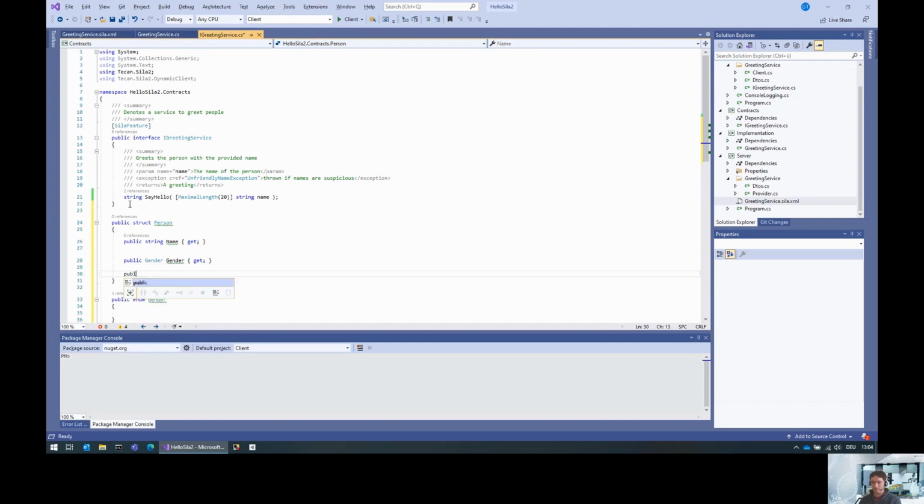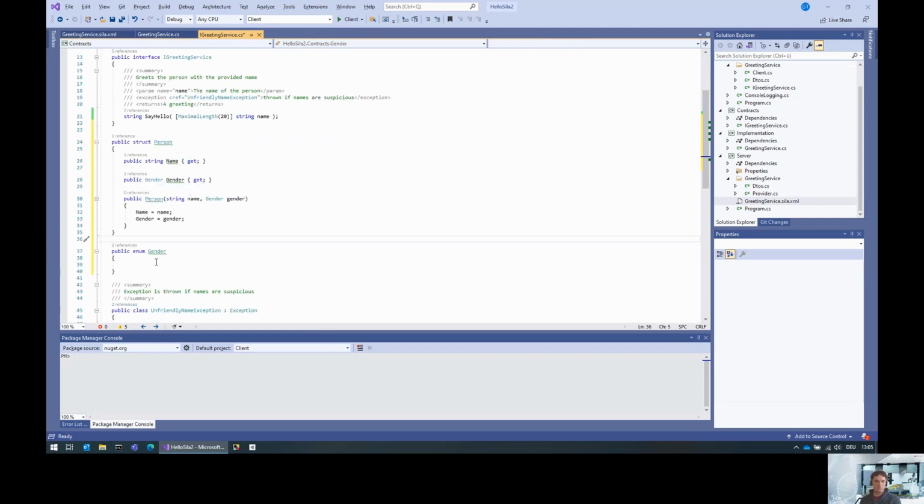Because we also need a constructor for that, it has a string name and the gender, and we just assign the values. And the gender could be female, male, diverse. Let's put female first, because otherwise I'm a sexist monster. If I put female in front, that's okay.